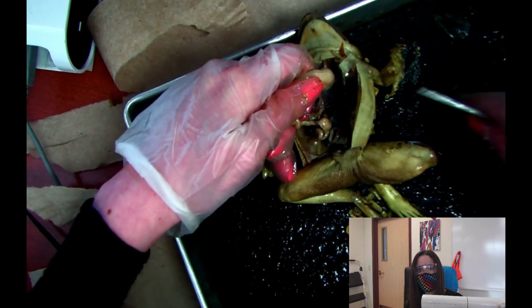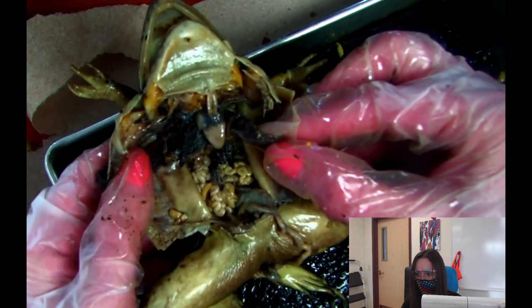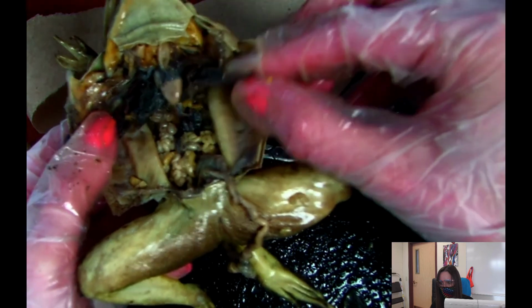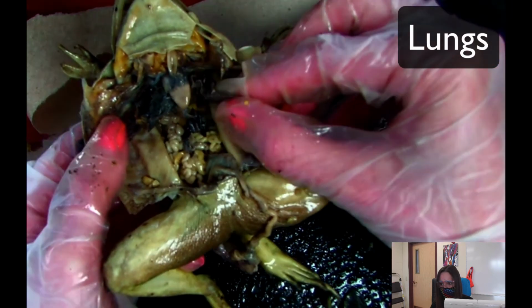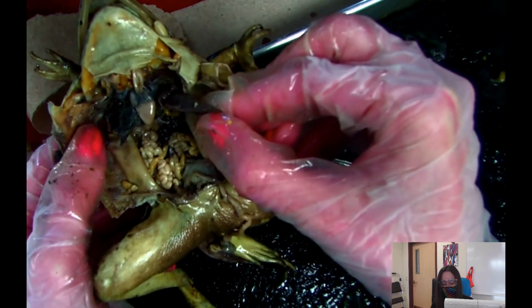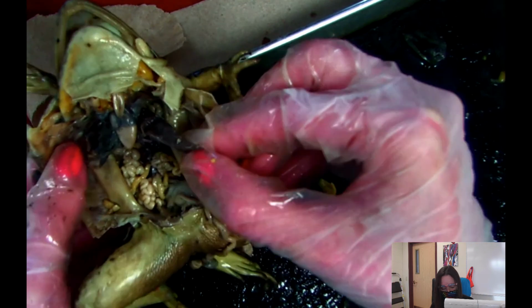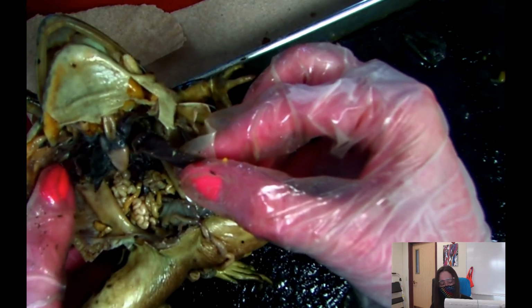So let's go ahead and do a transition. Alright, so I kind of took some of the parts out. This bag-like structure, this is one of the lungs. This is the frog's left lung. Okay, so notice how stretchy it is. So it looks a lot different from the liver. Okay, so you'll definitely be able to tell the difference between the liver and the lungs. I gotta say, students mix those up quite a bit. So it's very baggy, it's very stretchy because air needs to go through it.